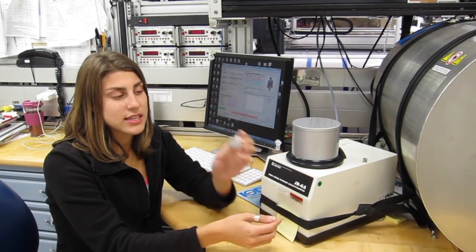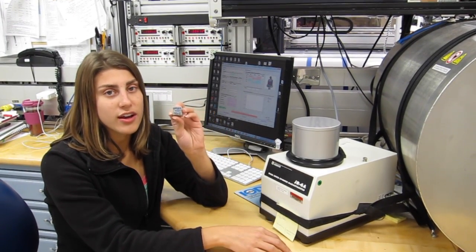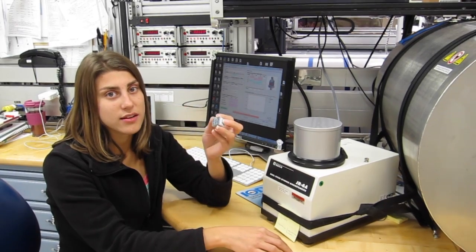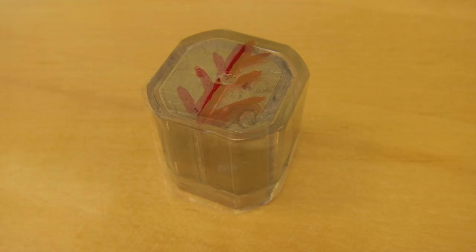What we do is we take these cubes—sometimes they're hard rock, sometimes they're sediment—and we put them in a plastic cube.